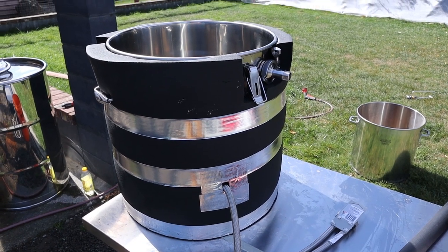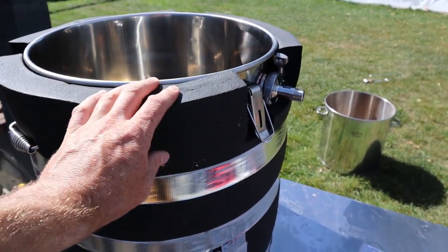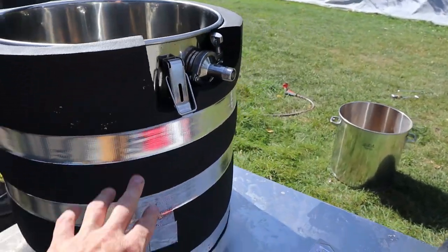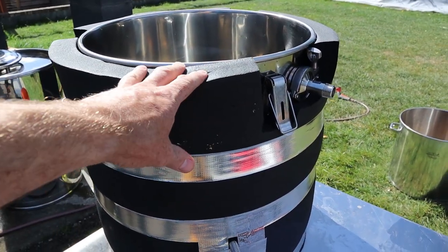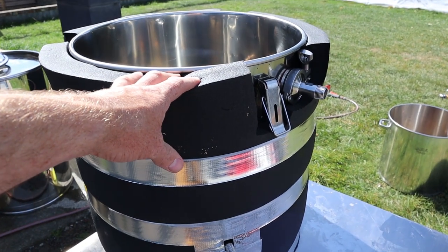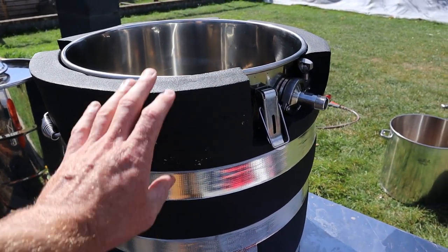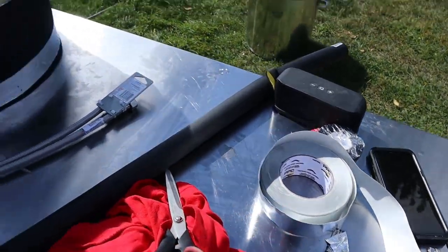The main body is insulated now. I've used Kflex sheeting — it's soft, malleable, and highly insulative. It doesn't have a sticky component, so I've used tape to hold a wrap of it around, cutting out spaces for all the fittings and pipe. The reason I haven't glued it is that on my last barrel that nearly caught fire, I'd glued Kflex on with high-heat glue and when I had to throw out the barrel, the Kflex was stuck to it and had to be tossed too. This stuff is quite expensive, so I want to keep it reusable — I've used metallic tape to strap it on instead.